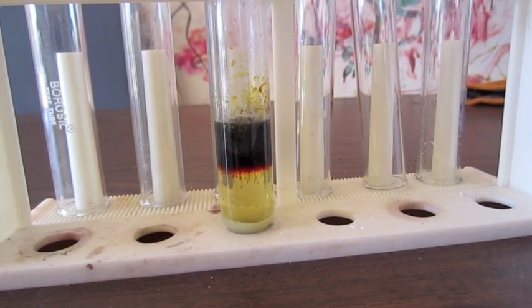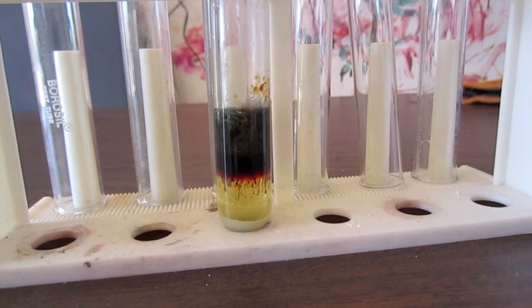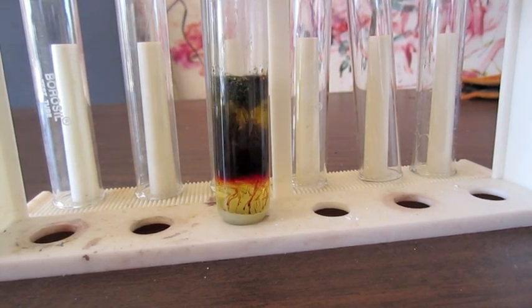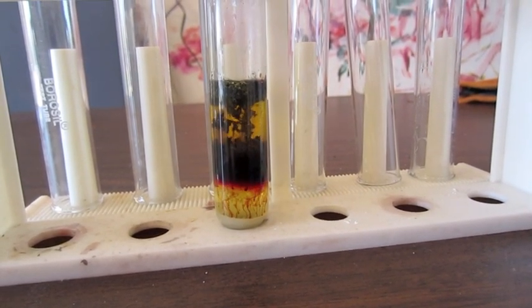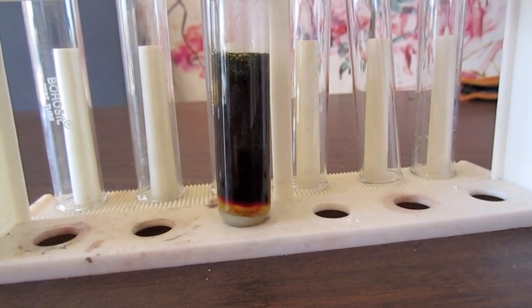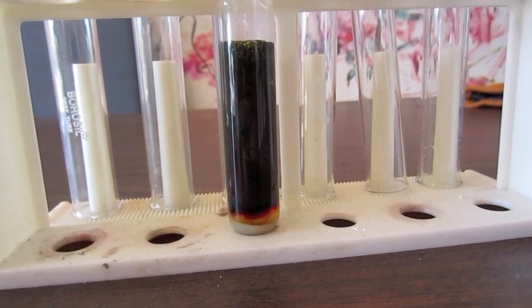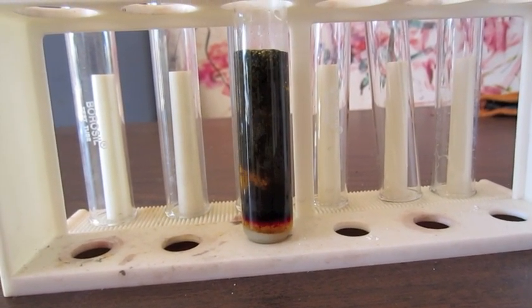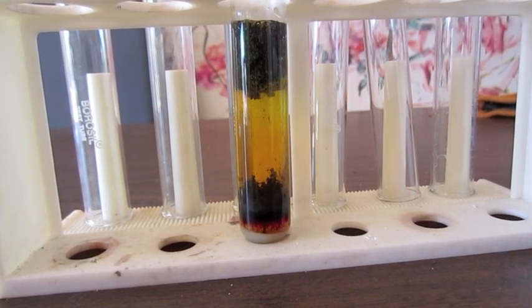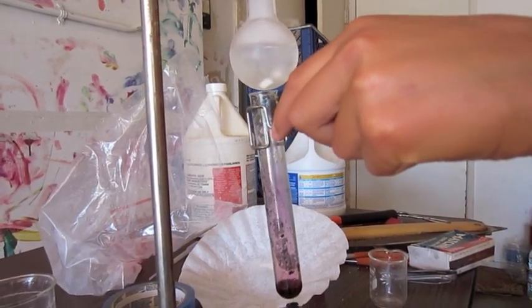Now, once the iodine concentration gets high enough, it'll actually precipitate out of solution, and it'll start floating up as chunks of solid iodine. There you go. You can see as I'm adding the bleach, or sodium hypochlorite, that it's floating out of solution and floating up as little chunks of iodine. Here's the end product. Now I need to purify it.